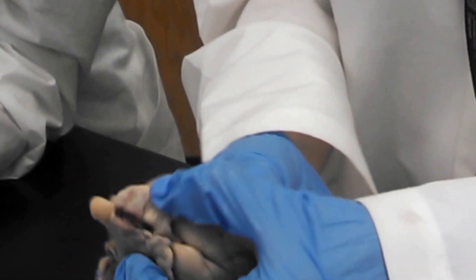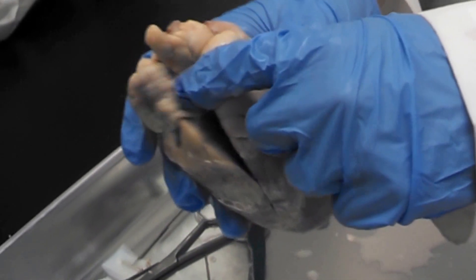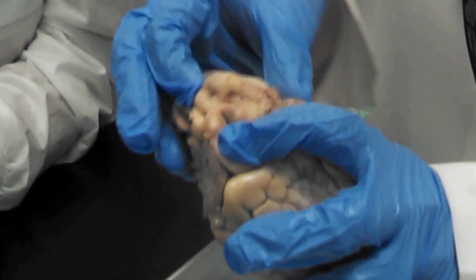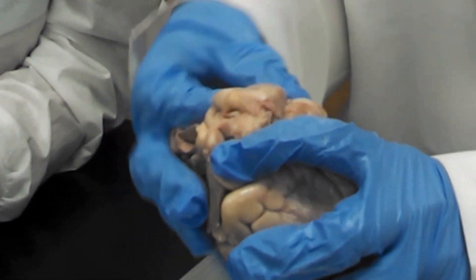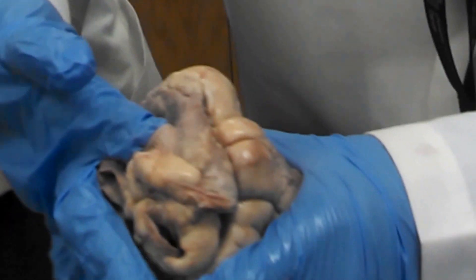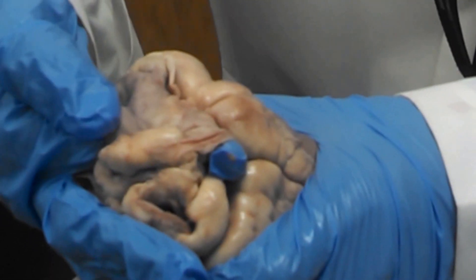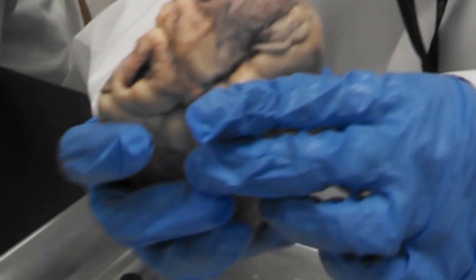Right here we have the right atrium with an auricle hanging off of it. Our right atrium connects here — if I were to stick my finger in here — with the superior and inferior vena cava. So superior and inferior vena cava coming into the right atrium.